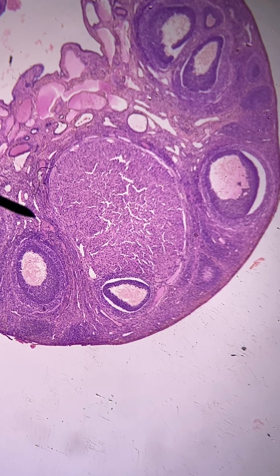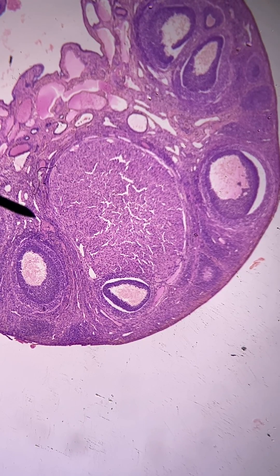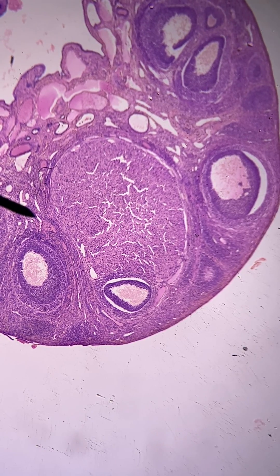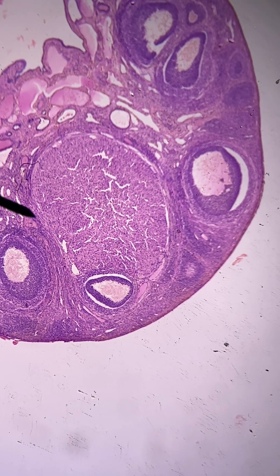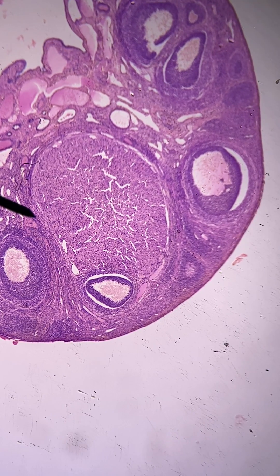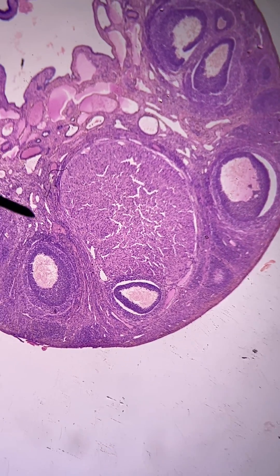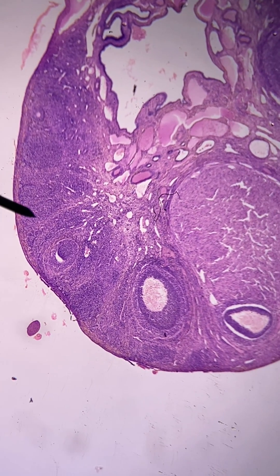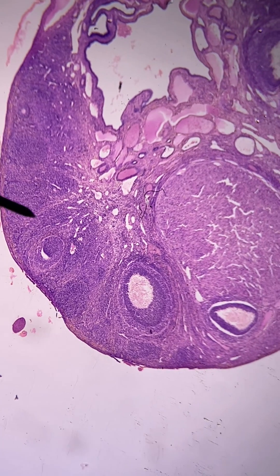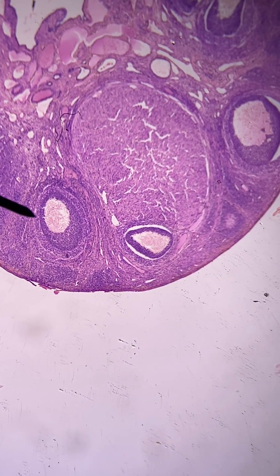We're in another ovary. This one has been chosen because it happens to show a structure that appears after ovulation. You can see some follicles hanging around here — this is a follicle right there.